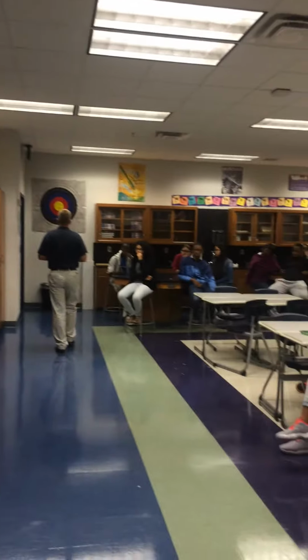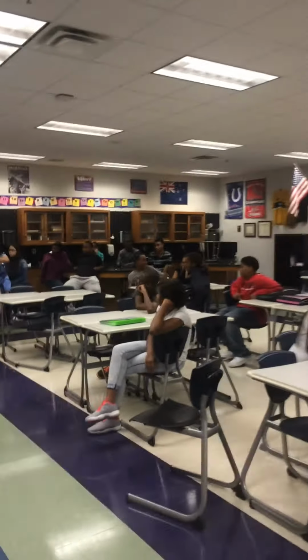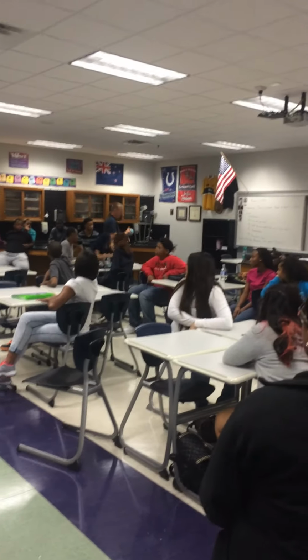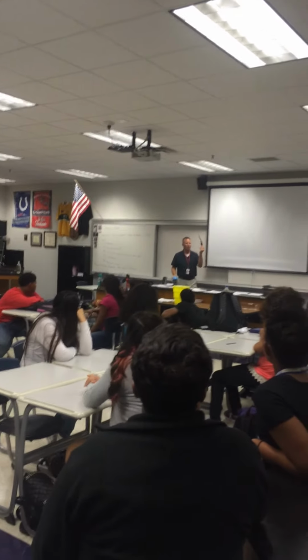All right. So what we're going to do now is, here in a minute, actually, we'll turn on the lights. Oh, I might need this. Oh, by the way, I have my fire starter right here. I'll start. Oh, wait. All right, here we go. Ready? 1, 2, 3. Oh my God. All right. Lights out.